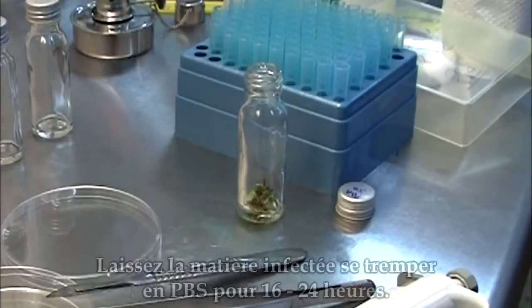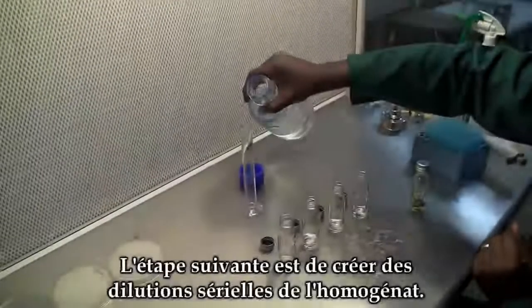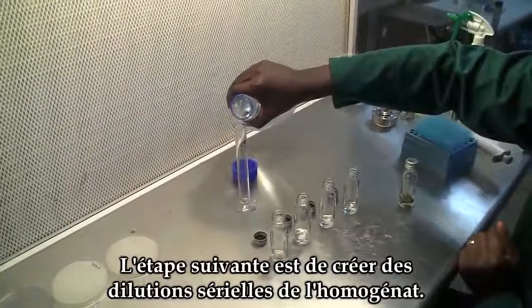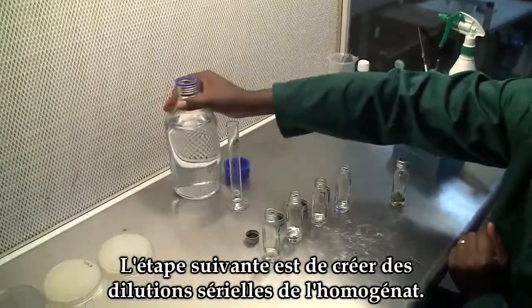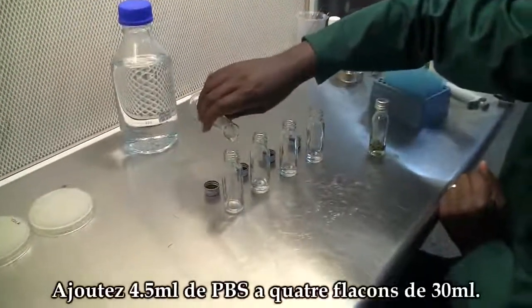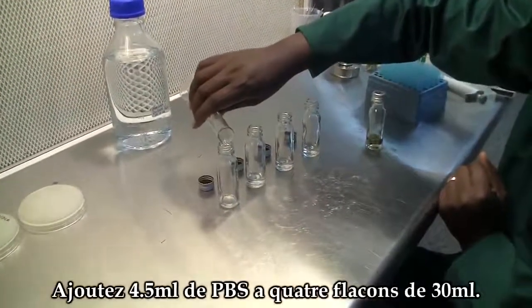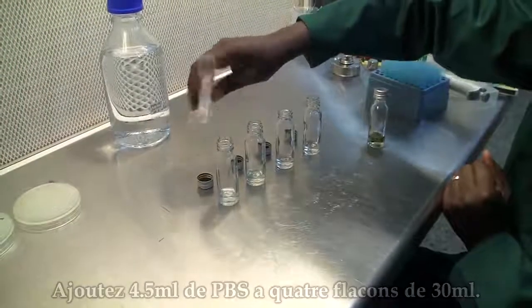Leave the leaf material to soak in PBS for 16 to 24 hours. The next step will be to create serial dilutions of the homogenate. To do this, add 4.5 ml of phosphate buffer into 4 bottles.